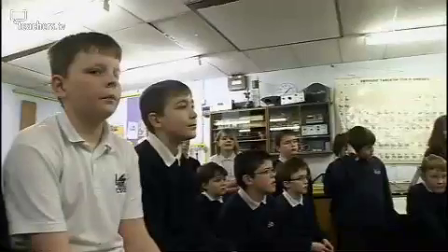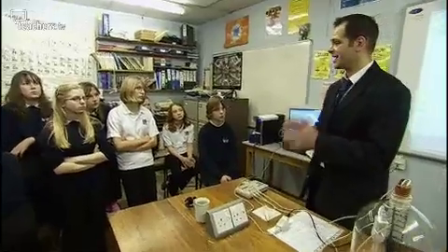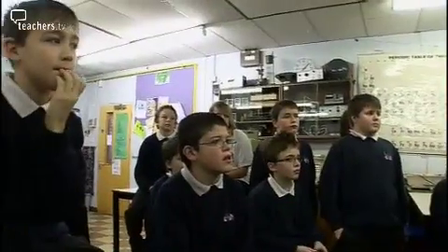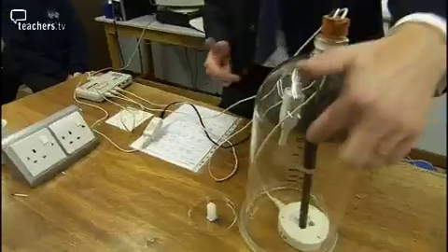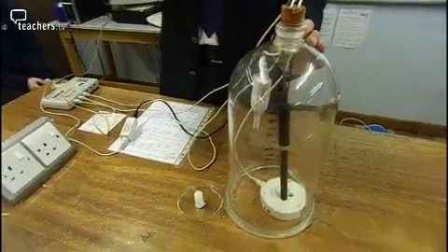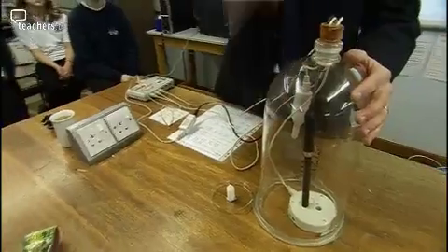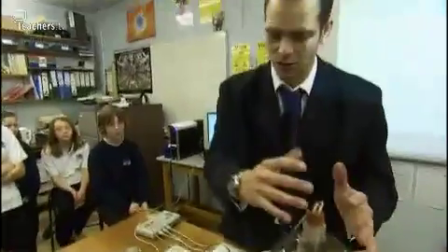Okay? Now, does anybody know how much oxygen is actually in the air we breathe? Zach? Is it 25%? You're not far off. It's actually 21%. So, when I start this off, the oxygen sensor is going to pick it up at 21%. What do you think is going to happen to the amount of oxygen inside this container? Bearing in mind, no air can go in and no air can go out. What's in here stays in here. Good, decrease as the candle burns it up.